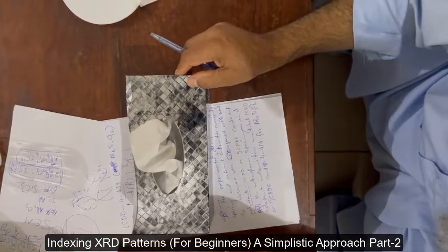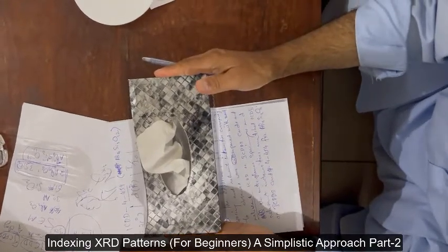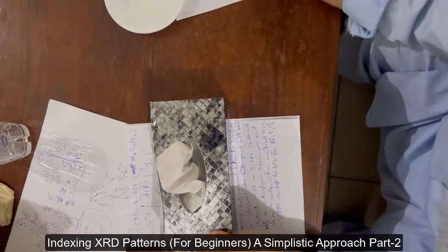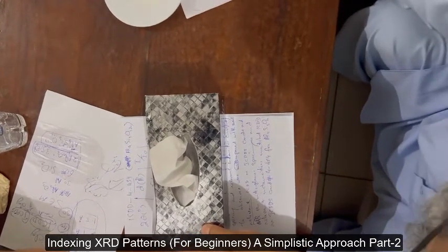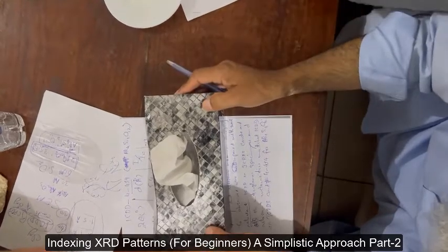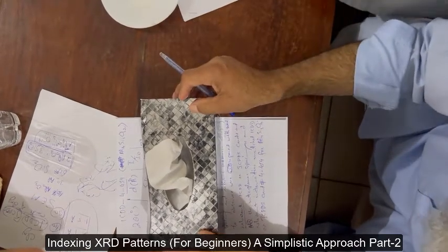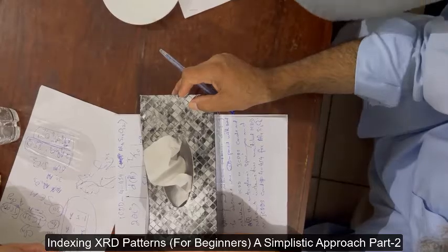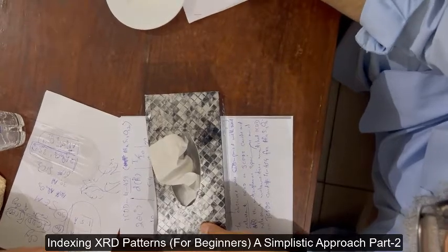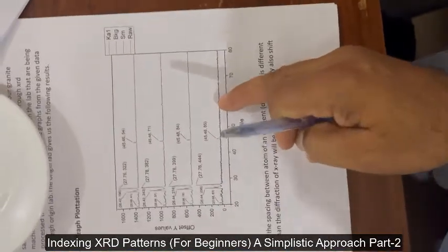The interplanar spacings are fixed. If this is the (100) plane, this is the (200) plane, here will be (300), here will be (400). If all reflections are allowed, all are present. If only even reflections are allowed, then you will have (200), (400), (600), (800) — the odd ones will be missing.